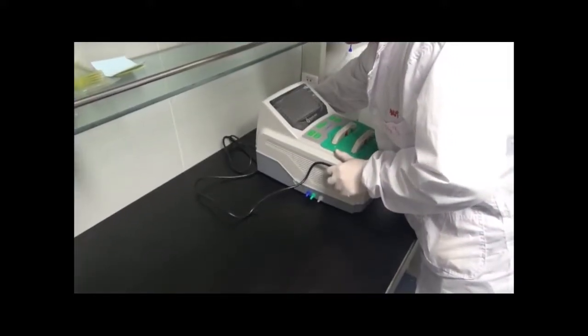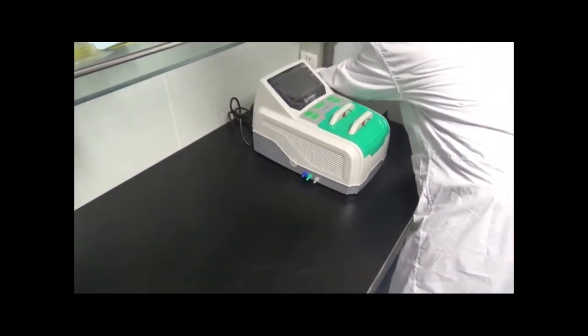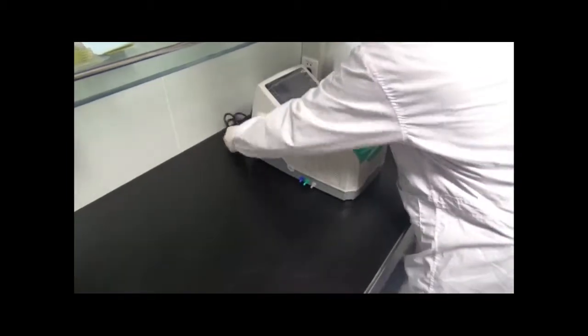Unpack your instrument and lay it on a flat surface and plug it into an outlet. Turn on the instrument to get it ready for operation.